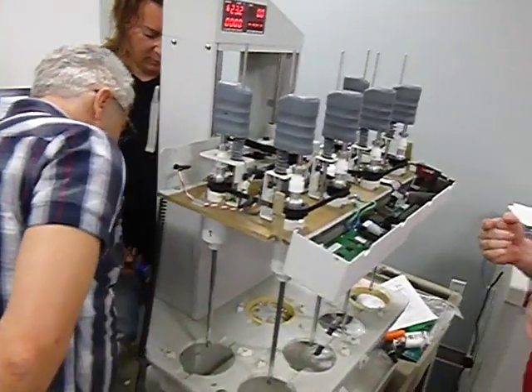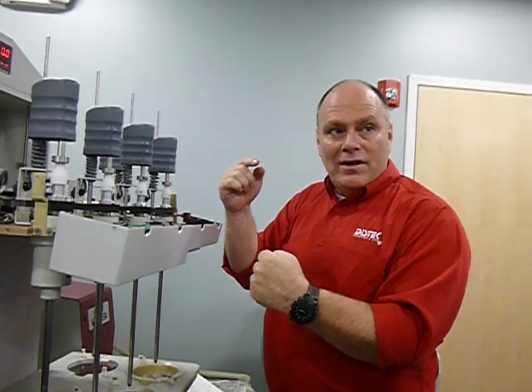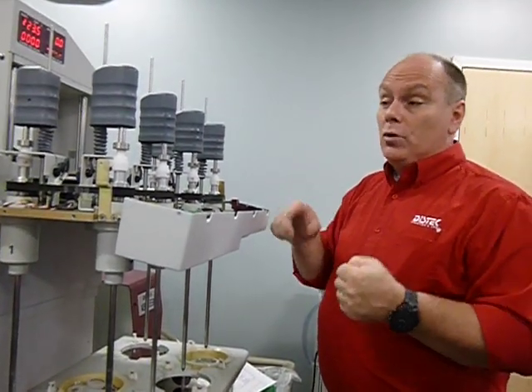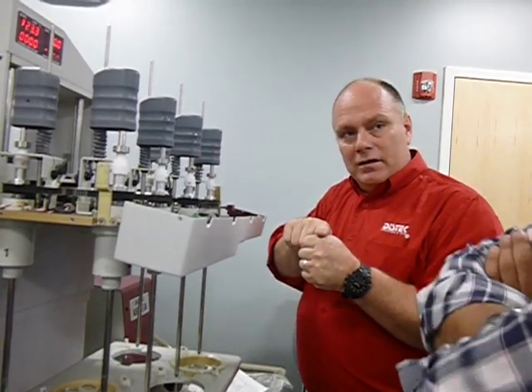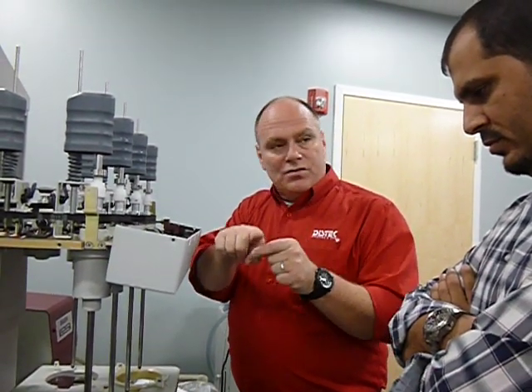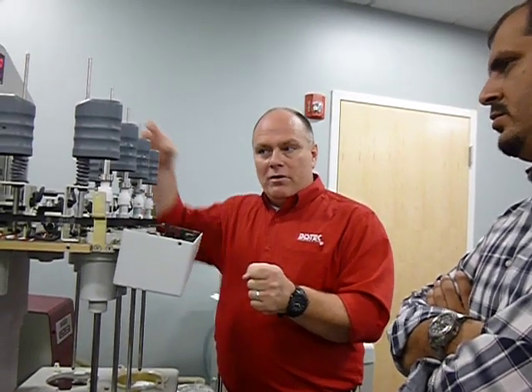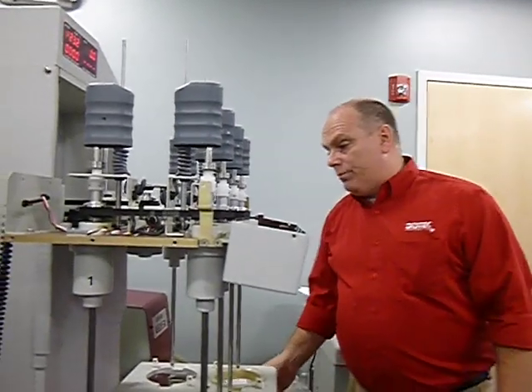And the only way to hold it is you have to actually hold the unit up, and you have to get a screw through there, and you got to compress the hydraulic actuator down. The screw, I should say not screw, a bolt, has to go in there. When that bolt goes through the eyelet of the hydraulic actuator, in between that and the outside pieces, there's 3 holes it has to go through. There's washers that have to go in between. And you got to do all that with one hand. You got to push that bolt through and get the washers in there and get it through, and it's a very difficult prospect.